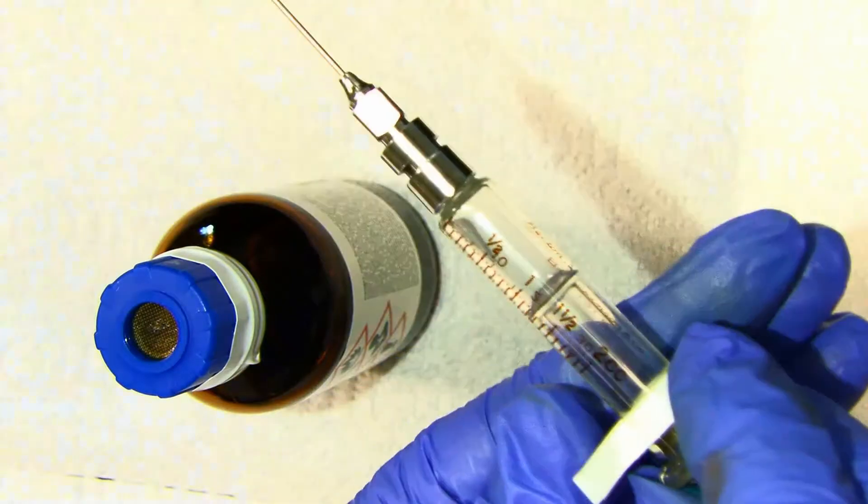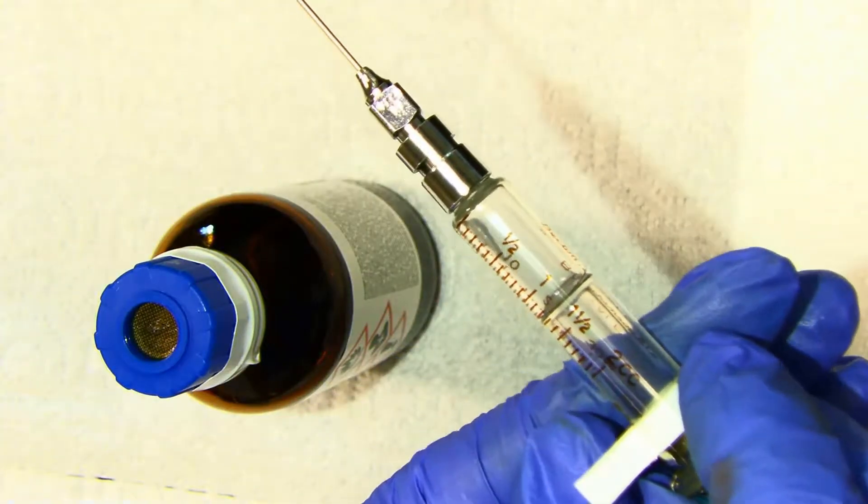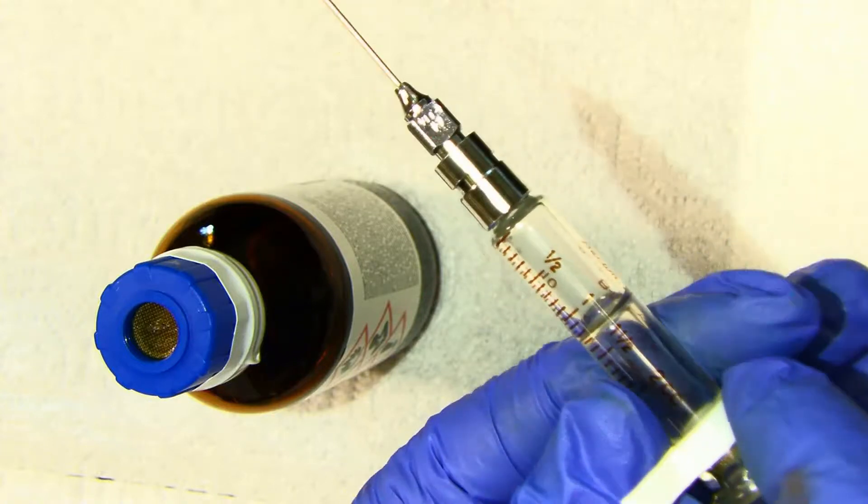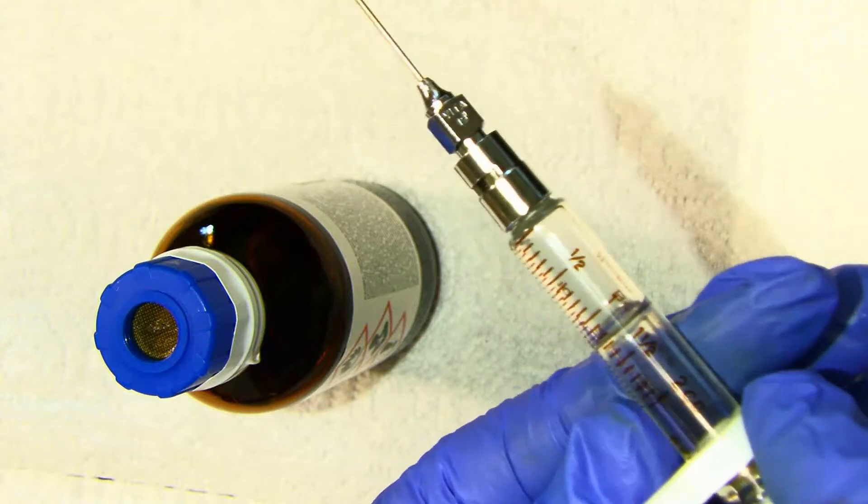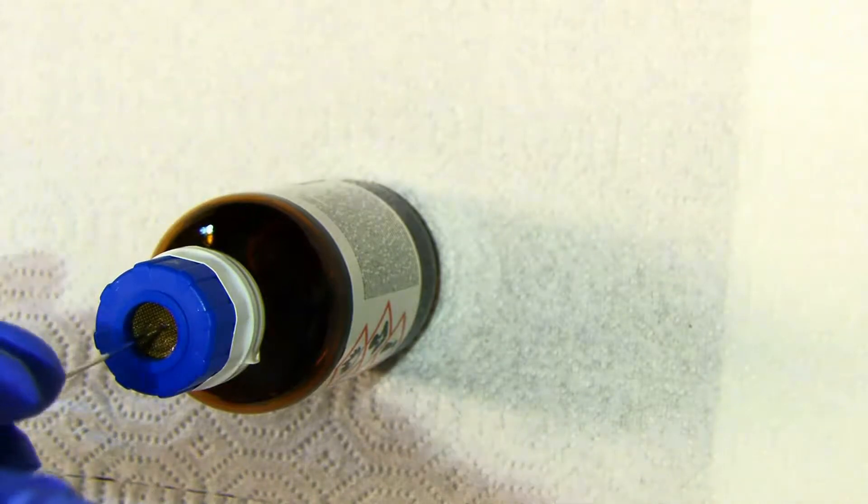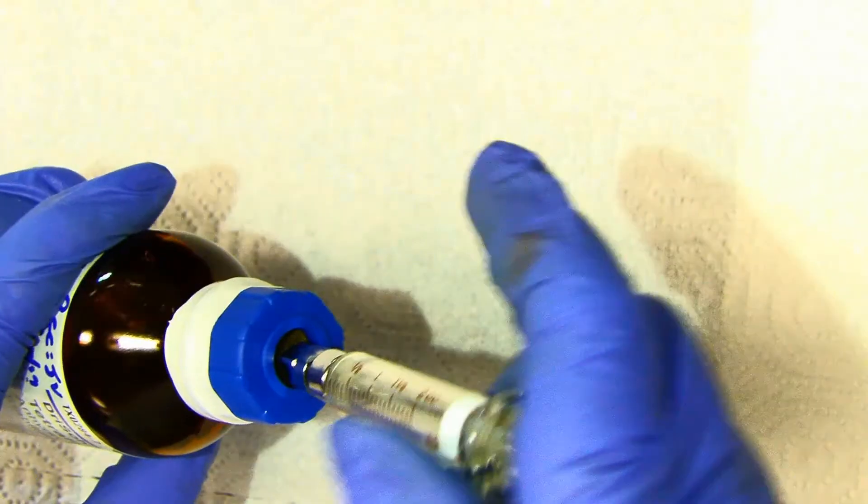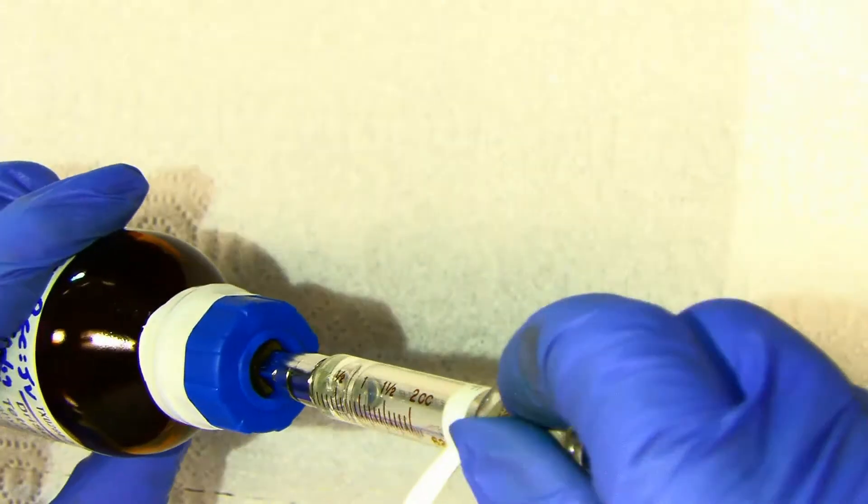You want to have at least volume of air as you are going to take liquid. I'm going to go for one mL. So I insert the air to equalize the pressure because we're pulling out a milliliter of volume. We start by pushing it through the septum, and it may take a little energy. Push the plunger in. Pull the liquid out.